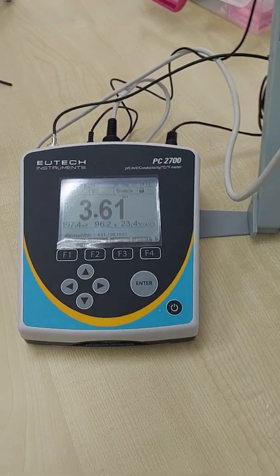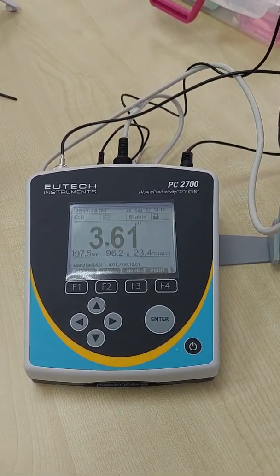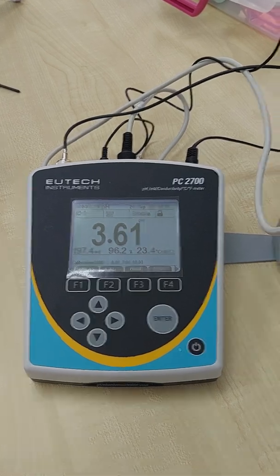Next, we will talk about the maintenance of the electrode and also the operation of the meter.